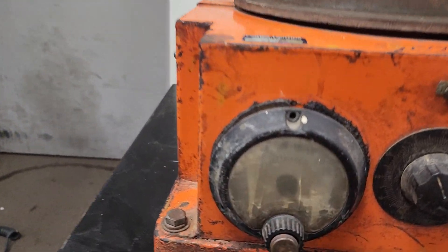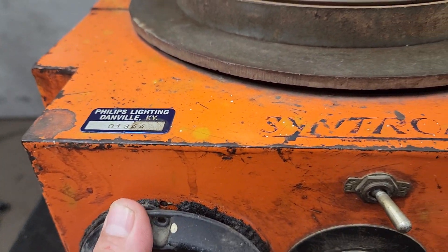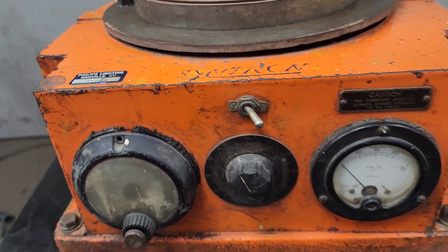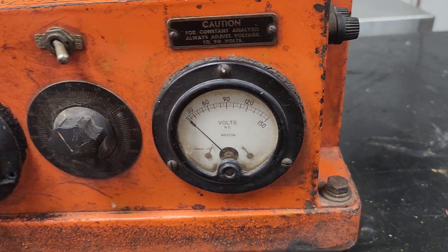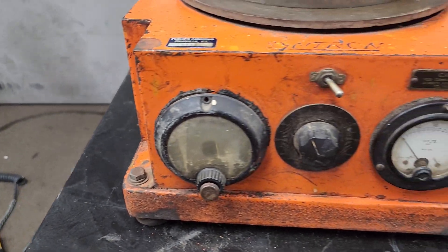This gauge, I think, is the timer, if I'm reading that right. But this is not secured in here so well and it doesn't really work. Volts, power. Like I said, plugged in — we've got it plugged into an extension cord there.